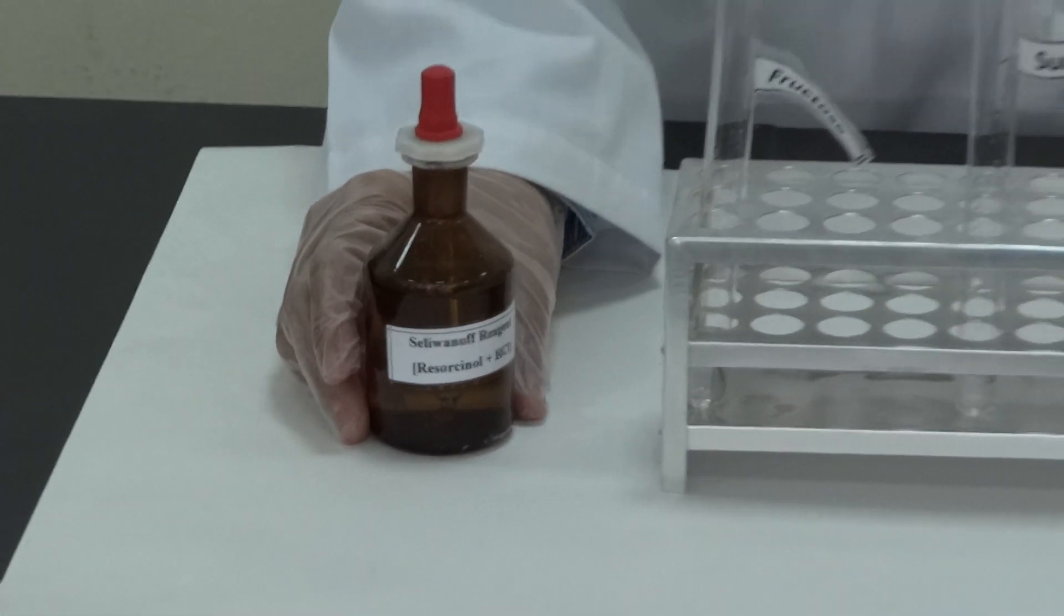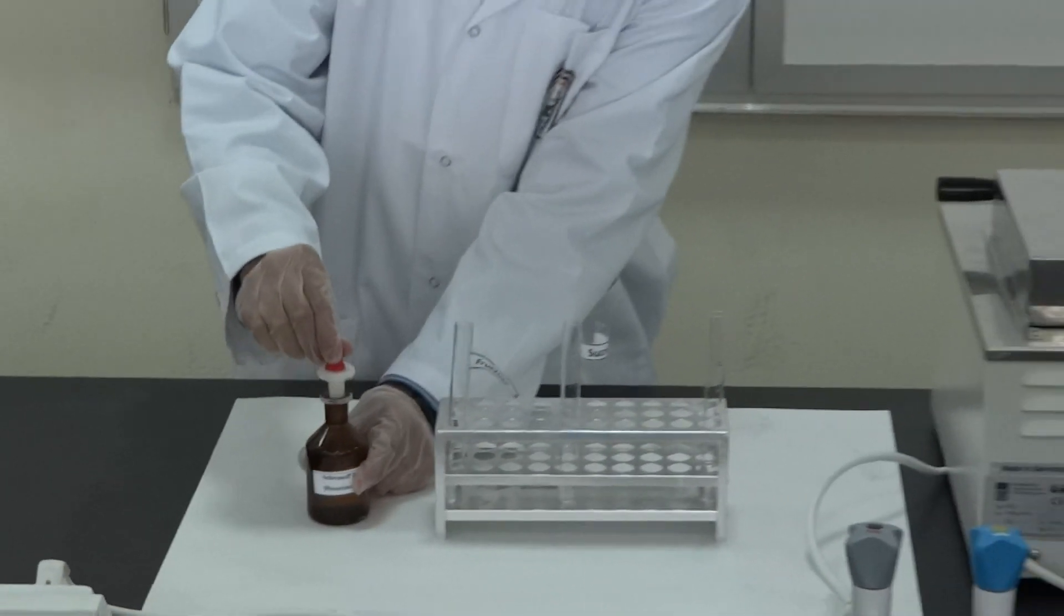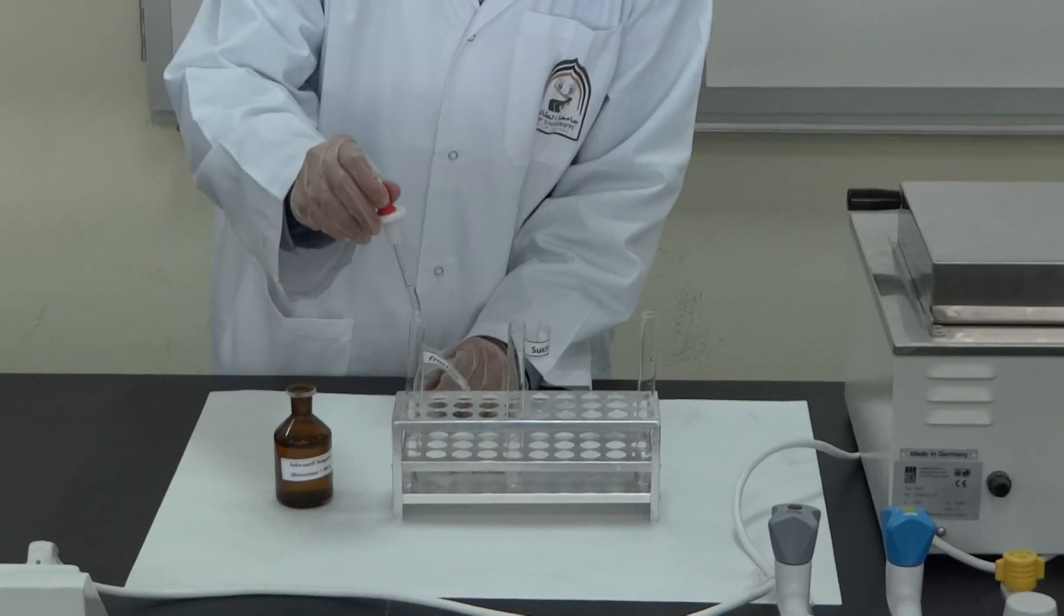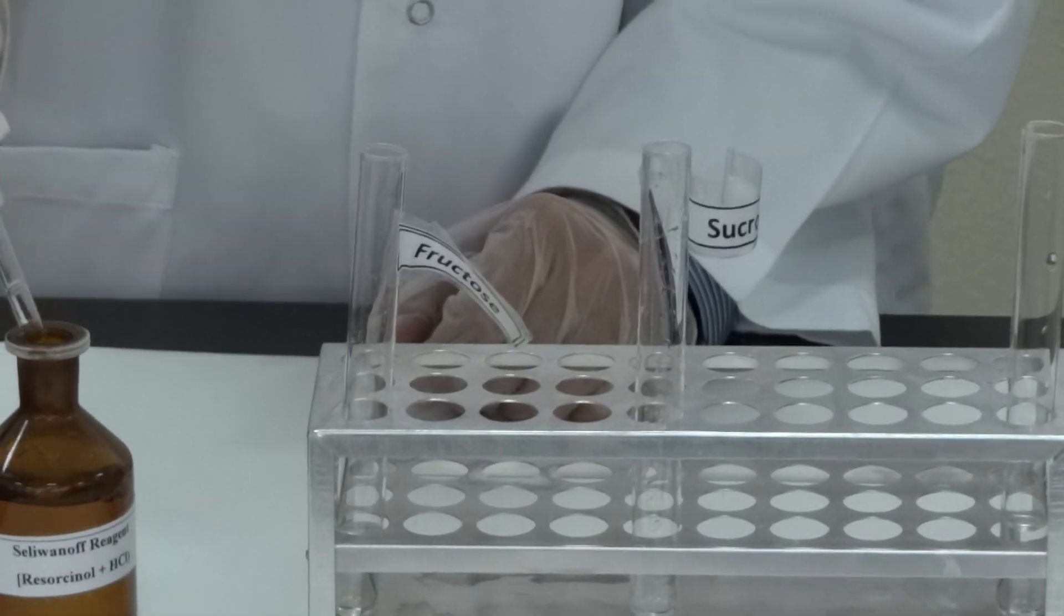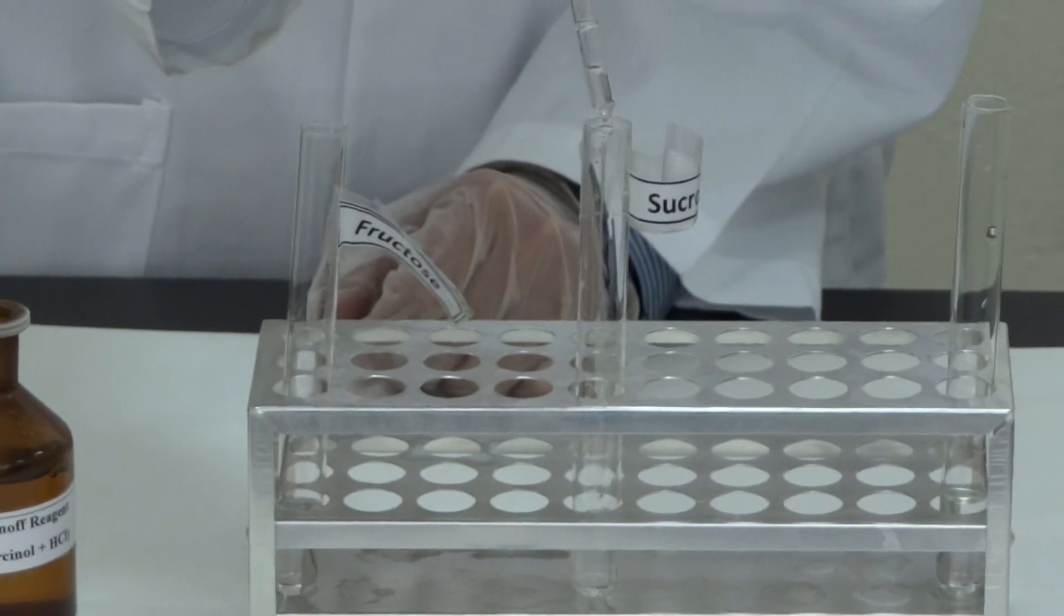How to do the test: simply take a few drops of Seliwanoff reagent in each tube, just a few drops.